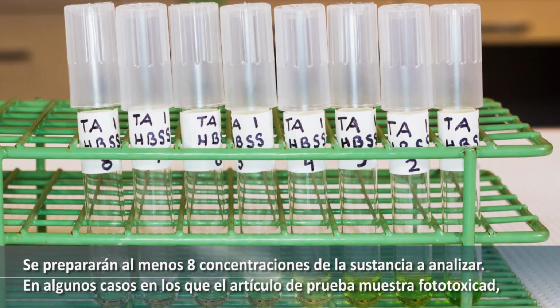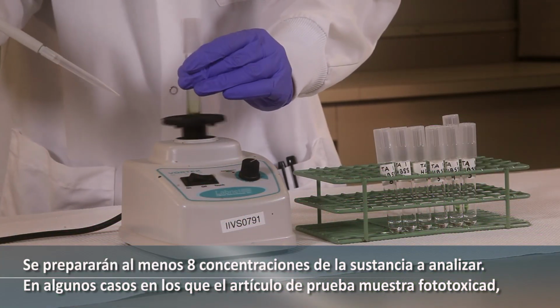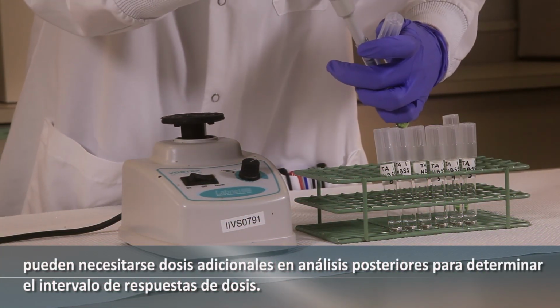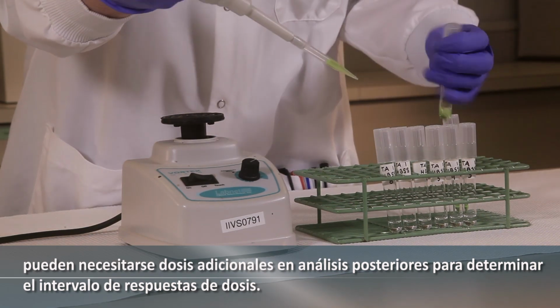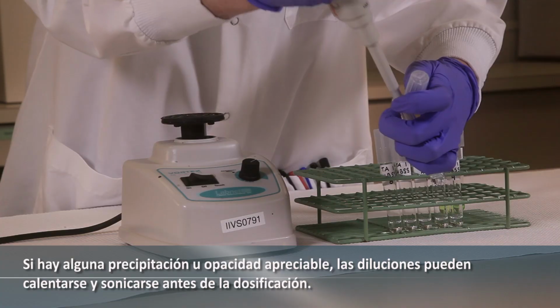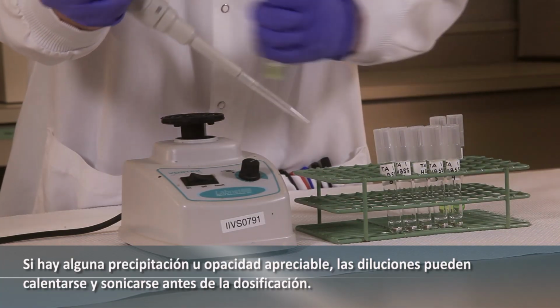At least 8 concentrations of the test substance will be prepared. In some cases, where the test article shows phototoxicity, additional doses may need to be prepared in subsequent trials to address the range of dose responses. If there is any noticeable precipitation or cloudiness, the dilutions may be heated and sonicated prior to dosing.